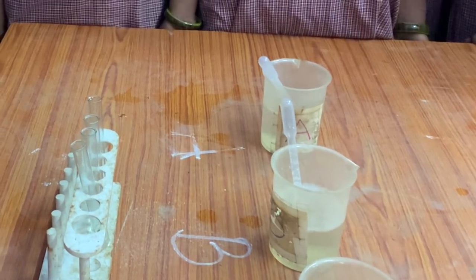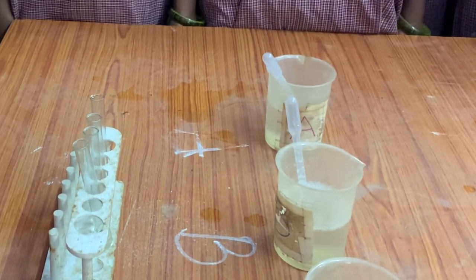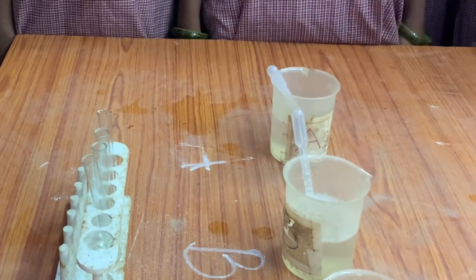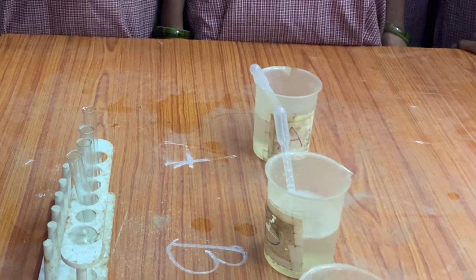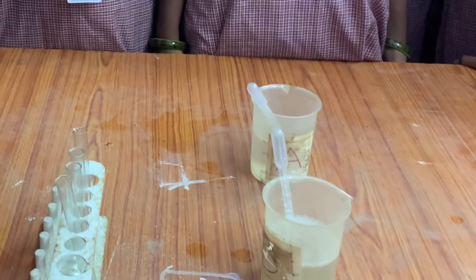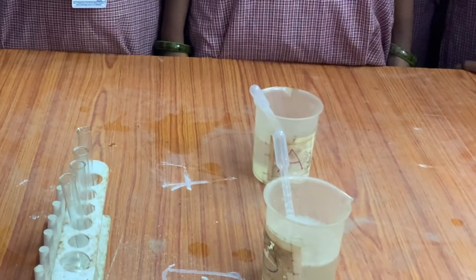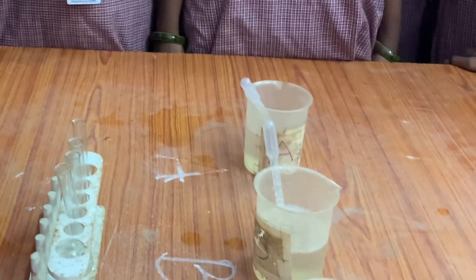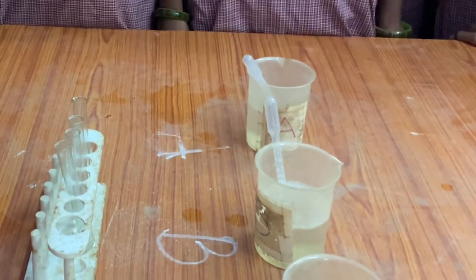Albumin — what does it indicate? Albumin. When acid is added to albumin, the acid-albumin reaction occurs. Place it in the test tube. When albumin is added, observe the precipitation reaction in the test tube.